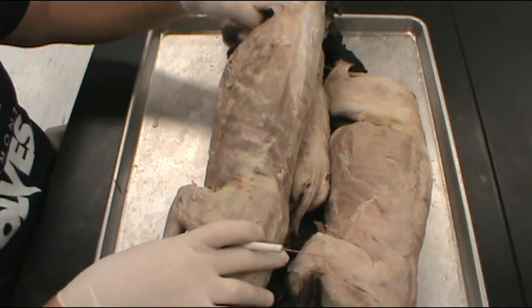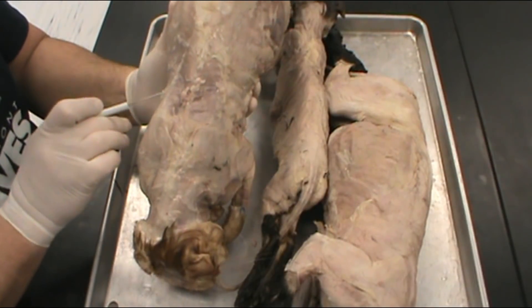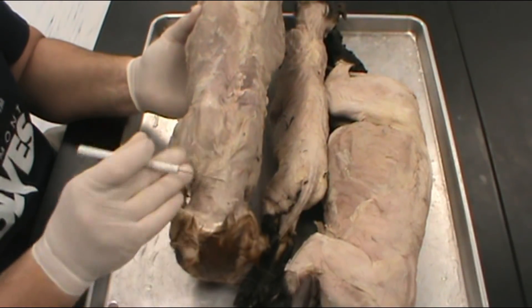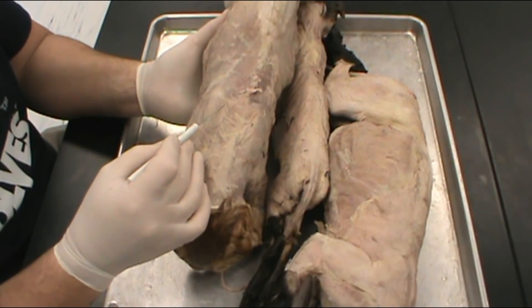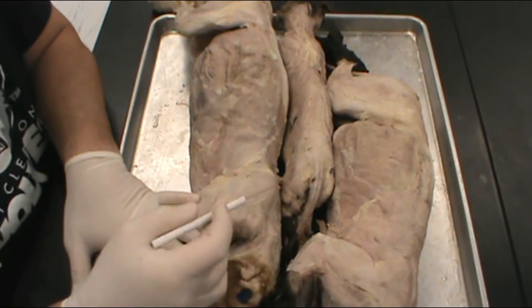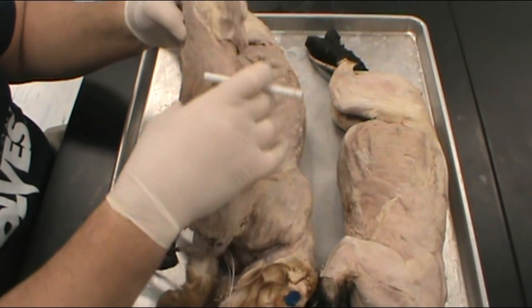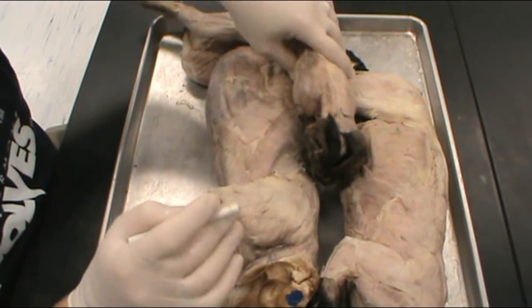Here we see the line that separates the latissimus from this triangular muscle, which is called the spinotrapezius. That takes us up to the muscle that covers the shoulder blade — also known as the scapula. Some of you may remember from the skeletal system there was a process on the scapula called the acromion process, so that may help you remember that this muscle is known as the acromiotrapezius. Then if we lay the cat on its side and put tension on the muscle, we can see this football-shaped muscle, which is known as the spinodeltoid. We'll look at different cats to find a cleaner example.